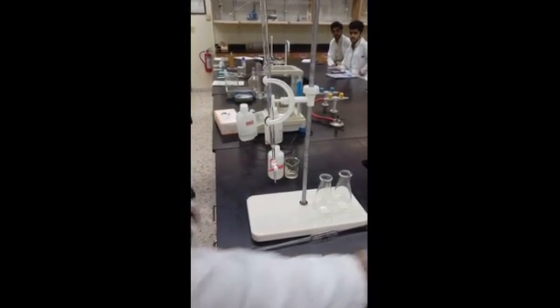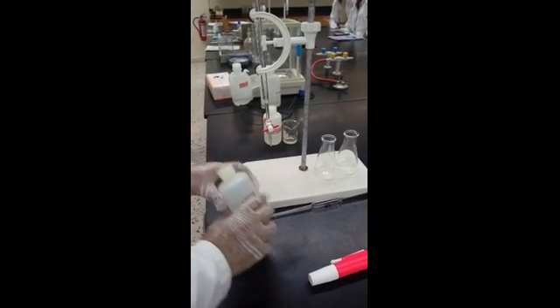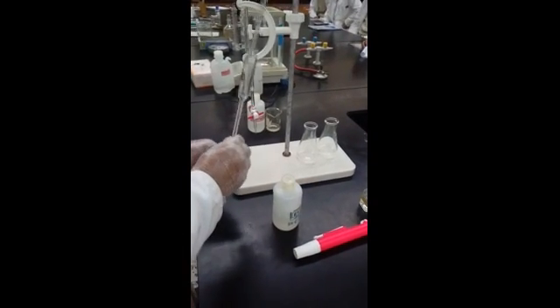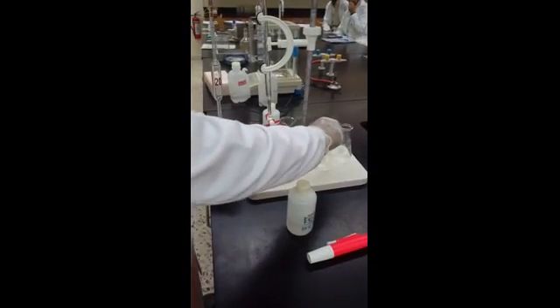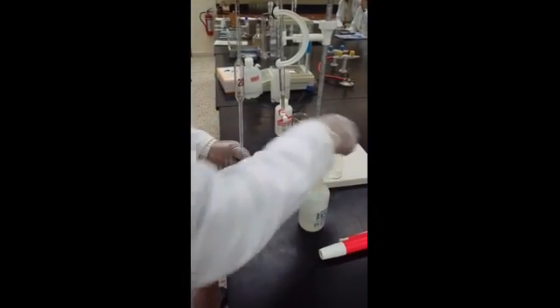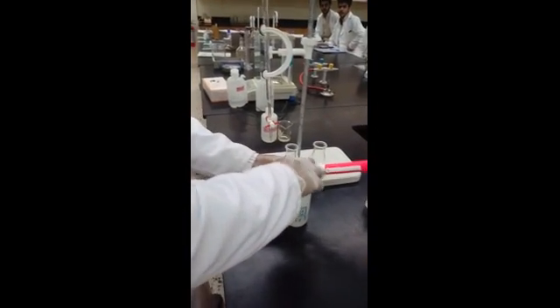Now we go to the unknown chemical. Unknown chemical is what? Acid. So what we do? We take the pipette here provided to us. It is 20 milliliter pipette. So we take our clean flask here and fill it with the pipette filler. Just fix it.